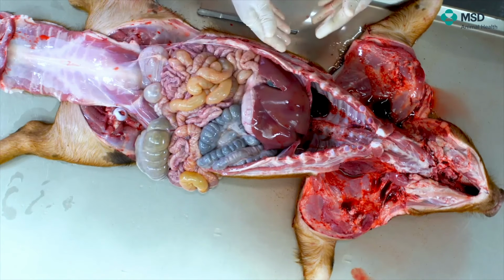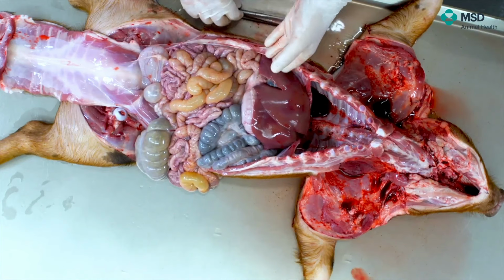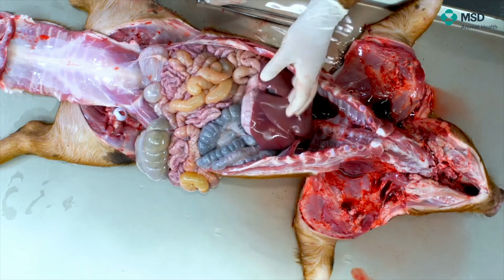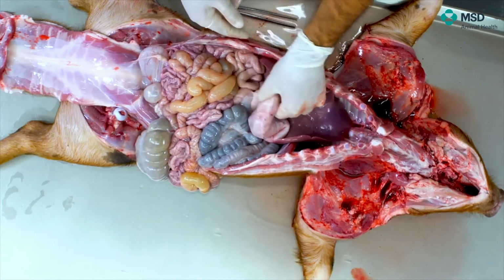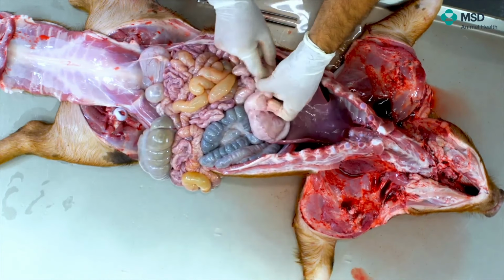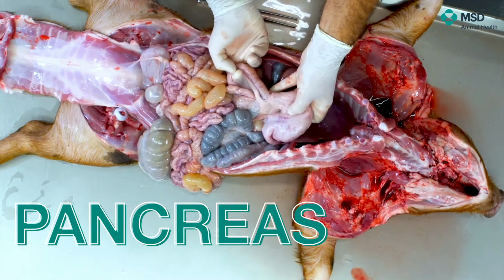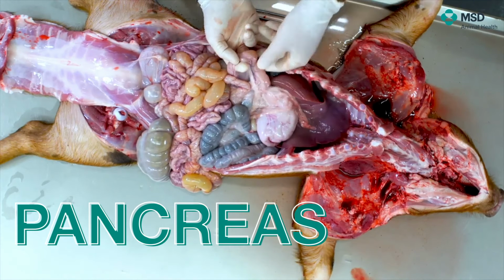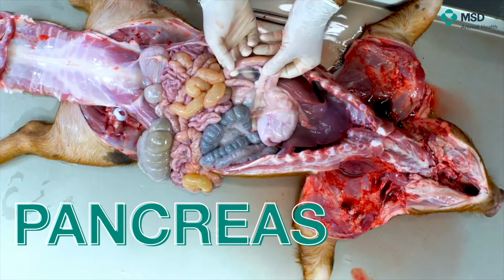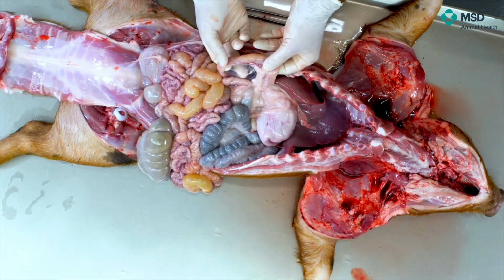Making those knots at the duodenum level is relatively easy, because here we see the liver, we see the stomach, and when you have the stomach here, you just have to pull it up, and finally you find this whitish structure. This whitish structure is the pancreas, and here you have the duodenum, and you will see a ligament here. This is the duodenocolic ligament. So usually what we do is to cut it, and we will make the knots here.